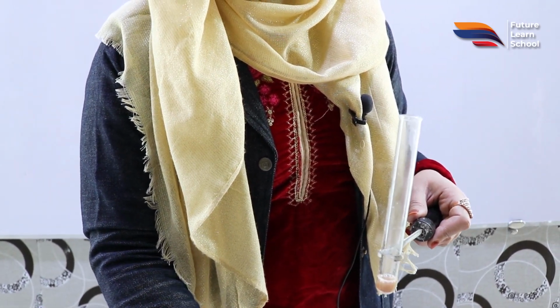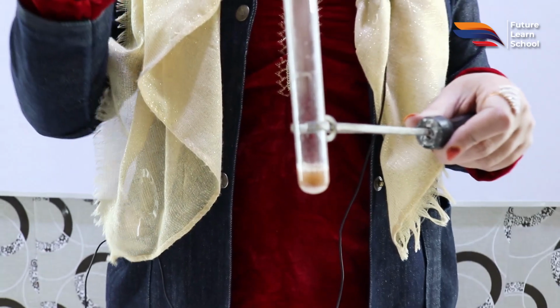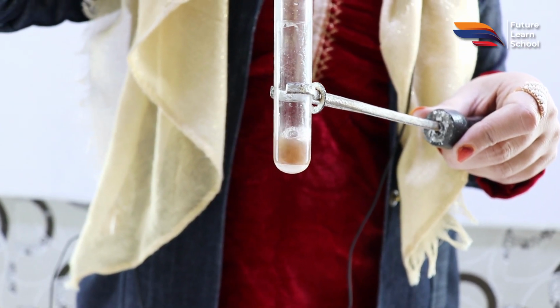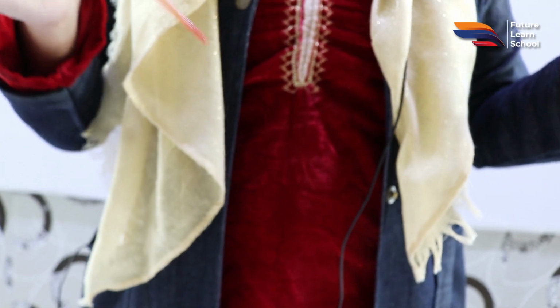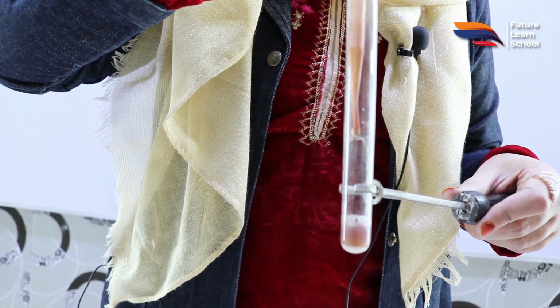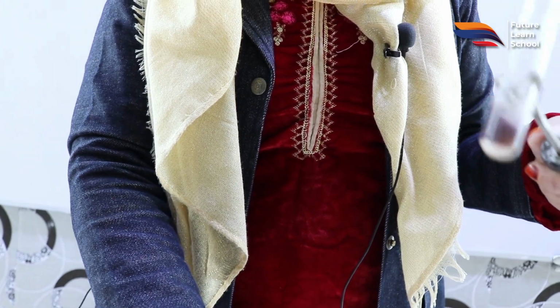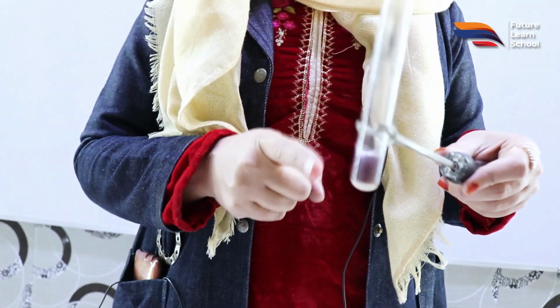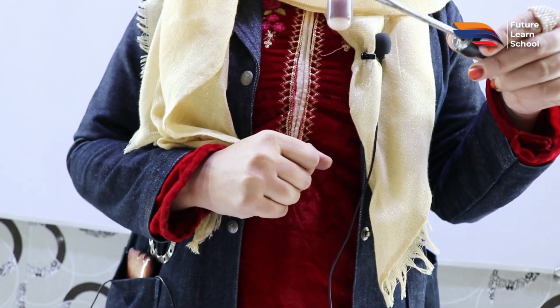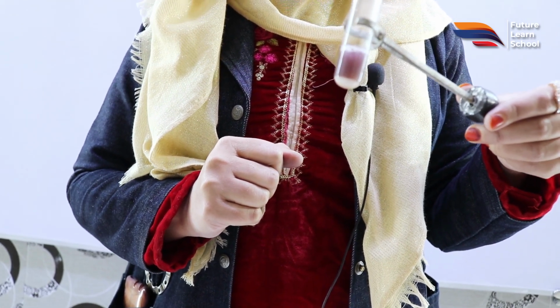So it's very interesting knowing what color would be produced by adding drops of iodine. So you have to add these drops of iodine into this potato extract, and we will see whether there is a change in color or not. And you can see the color has changed after adding a few more drops of iodine. So you can see the color of the potato extract has changed, and this change in coloration indicates that the potato extract contains starch. You can see the color of the solution has changed to purplish black coloration.